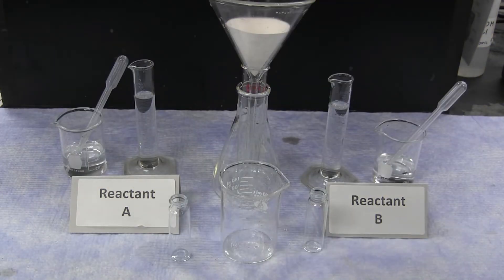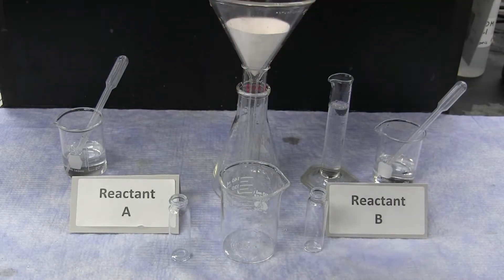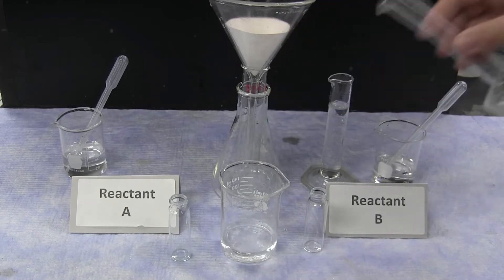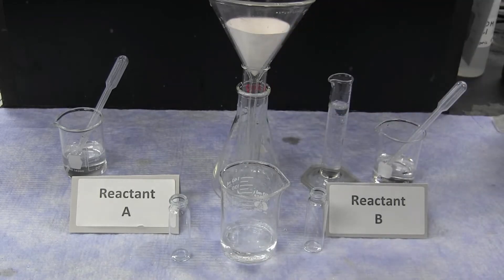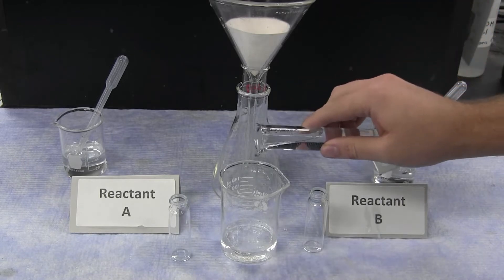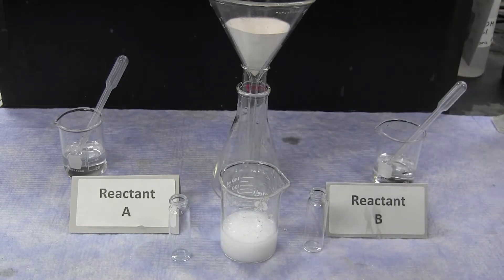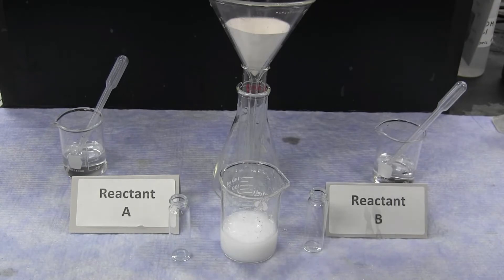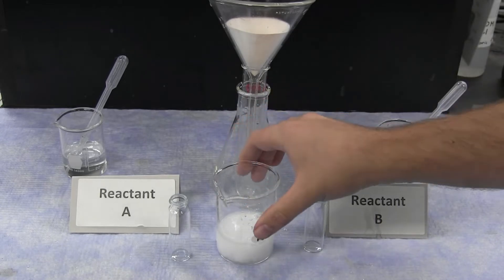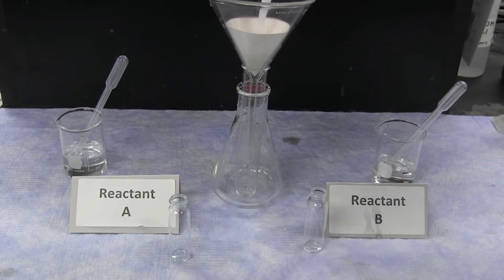In the reaction, exactly 25.0 milliliters of reactant A is combined with 25.0 milliliters of reactant B. The result is a white precipitate that is formed. This precipitate can then be filtered through a piece of filter paper.